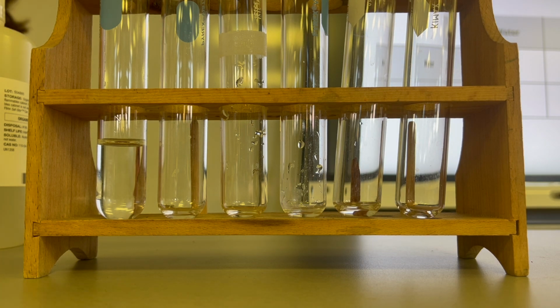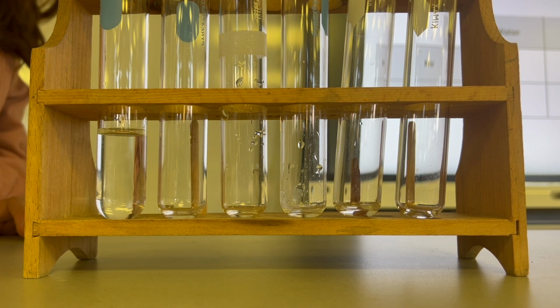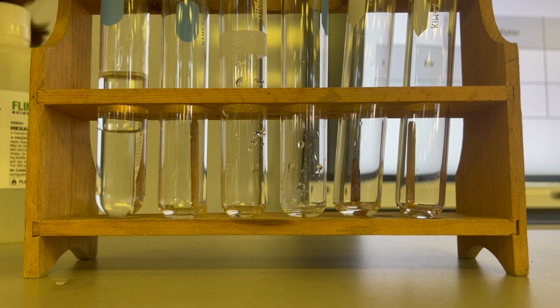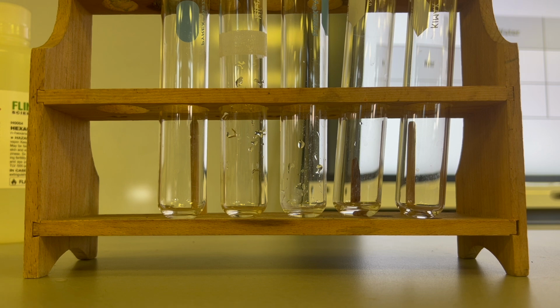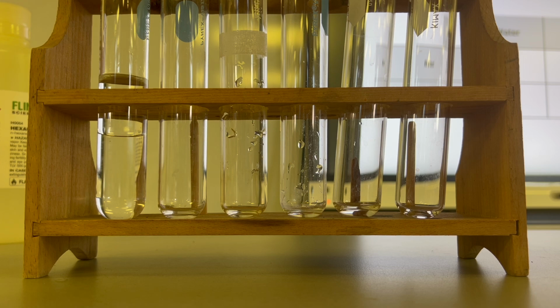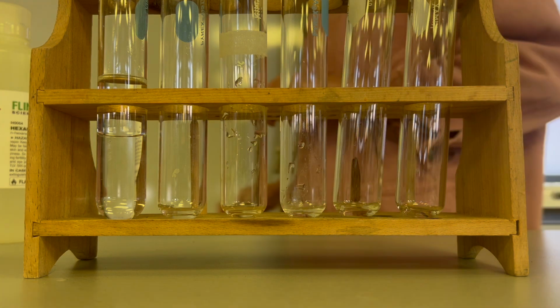First one is water and hexane. So pour some water in here. And here's some hexane. I'm going to pour the hexane in there. All right. Water and hexane. What do you notice about them? This may remind you of oil and water, right? You've got that line that separates the hexane from the water.